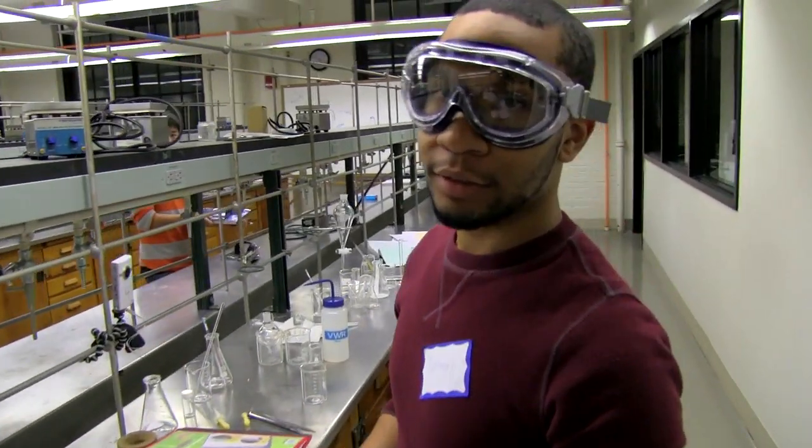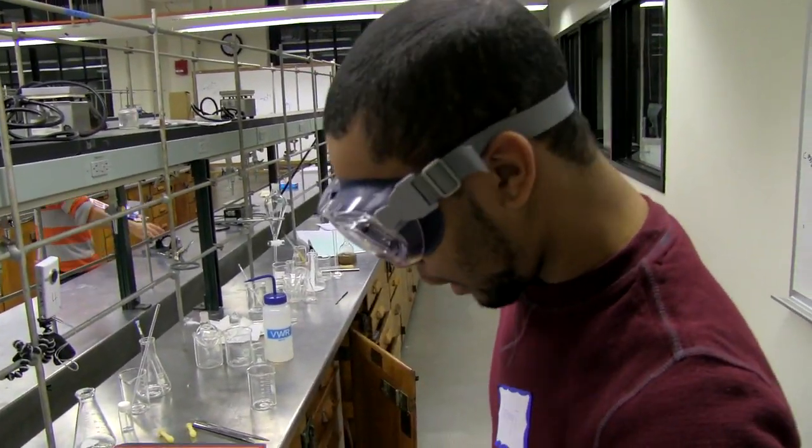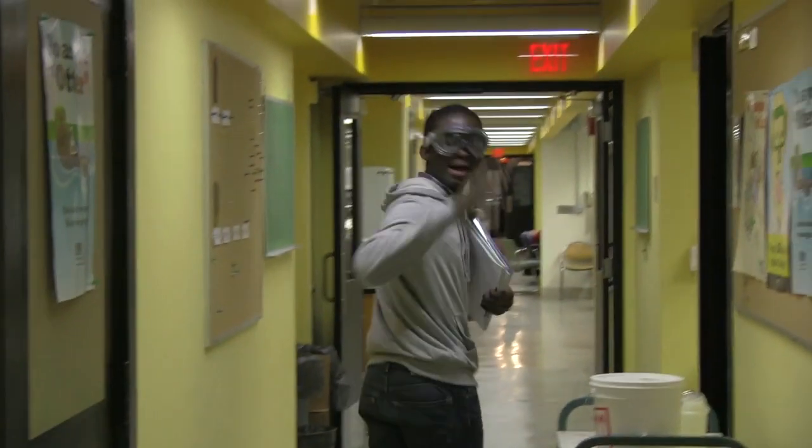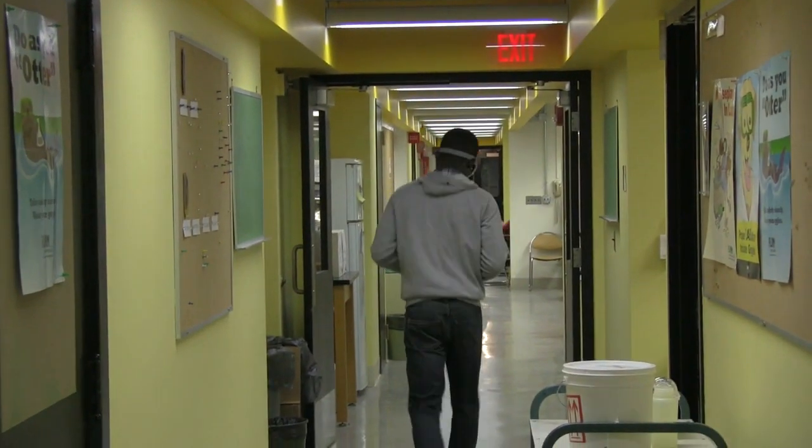70% yield, so not wonderful but not too bad. When I got a sample and I got a pretty good yield and it was pretty pure, I was happy. And that's it. The first day is done.